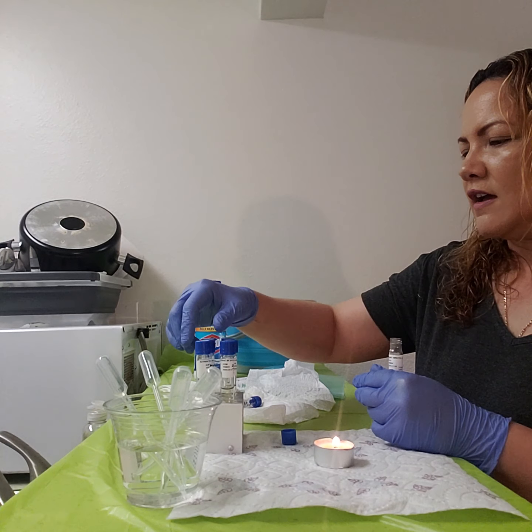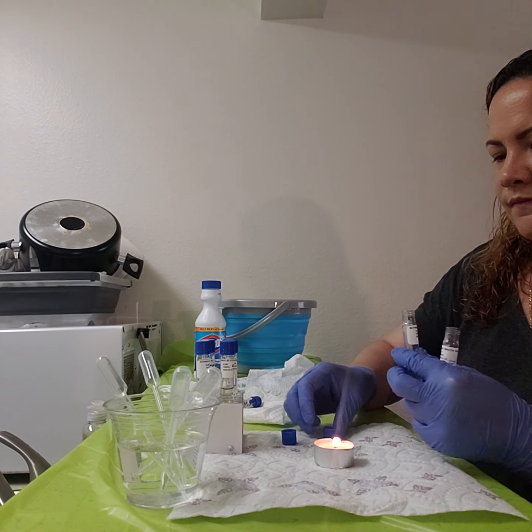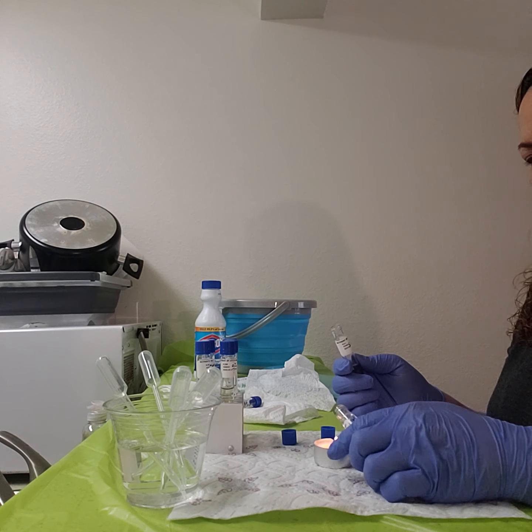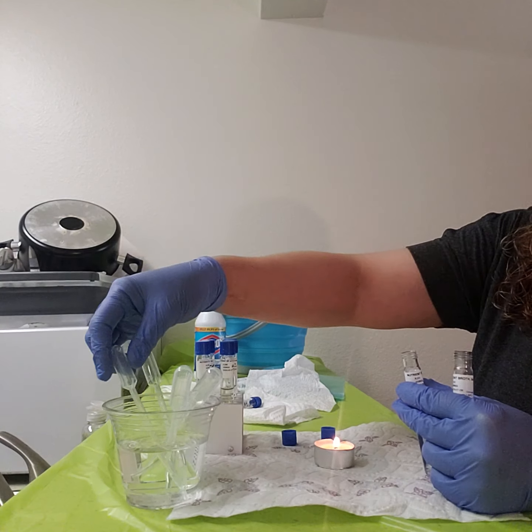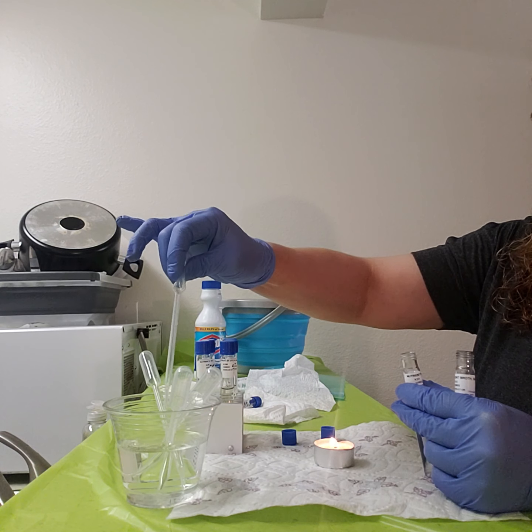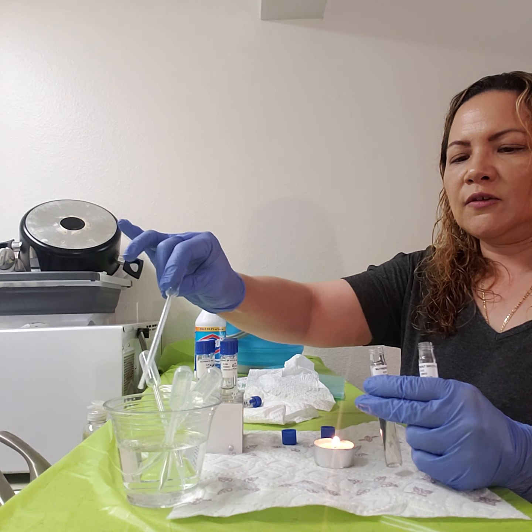Moving on to the last one, that's 15%. Sterilizing this one. Oops, that's a scary one. Okay, and then the top of this again. Okay, and this one's pretty self-explanatory. You have to do like a 48-hour incubation.